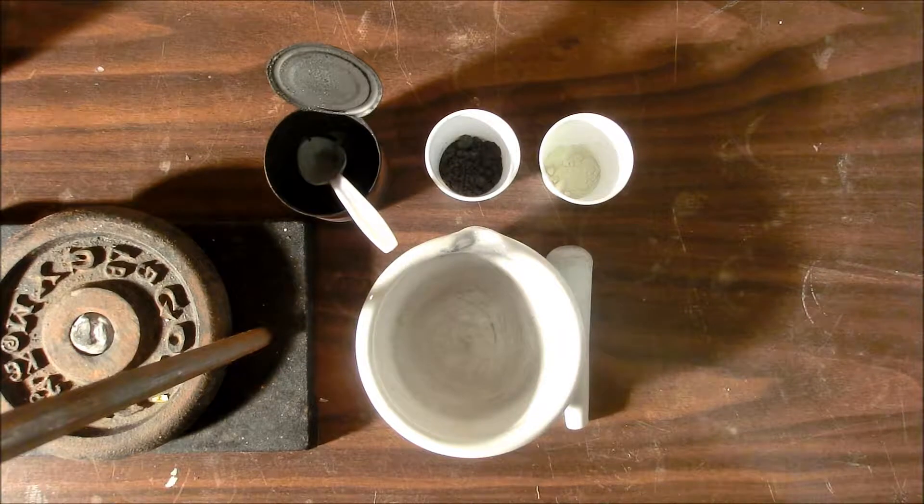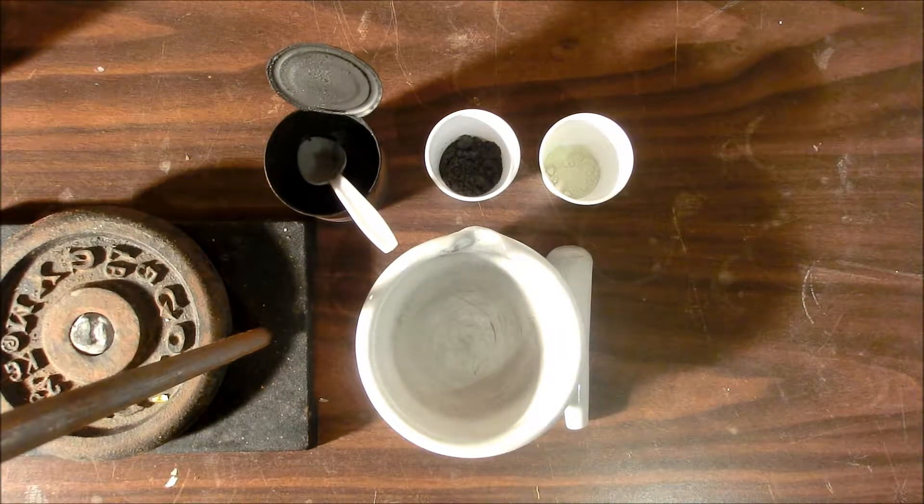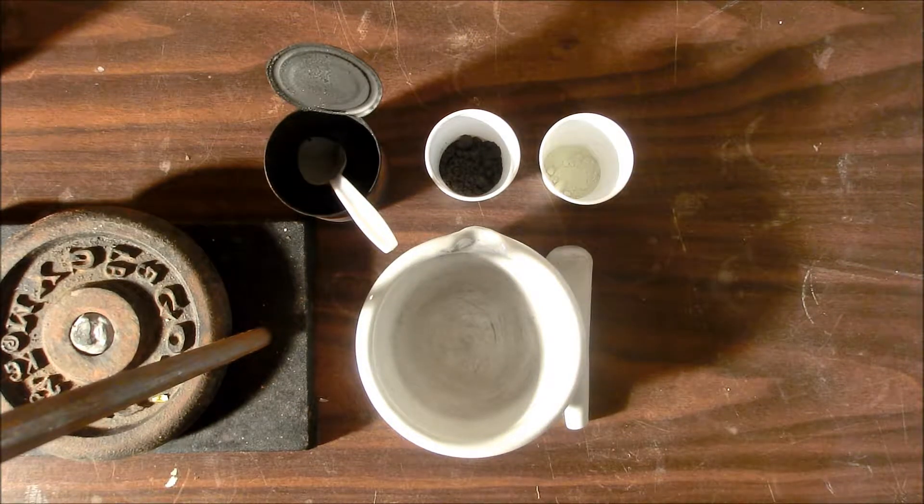So to make a hydrogen sulfide gas generator, I'm going to use iron sulfide, and I'm going to show you real quick how to make your own iron sulfide from readily available chemicals.